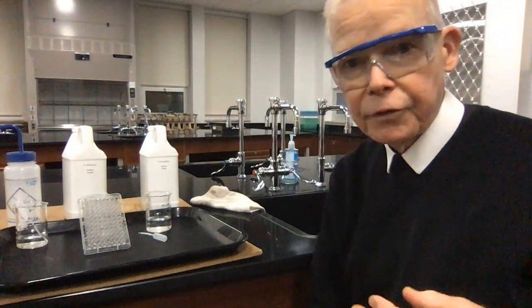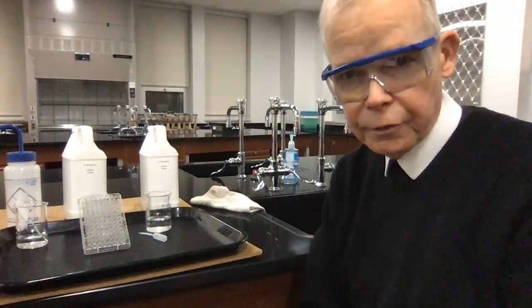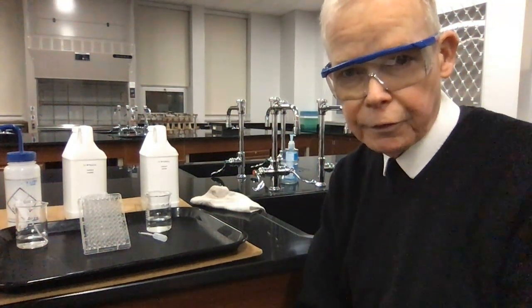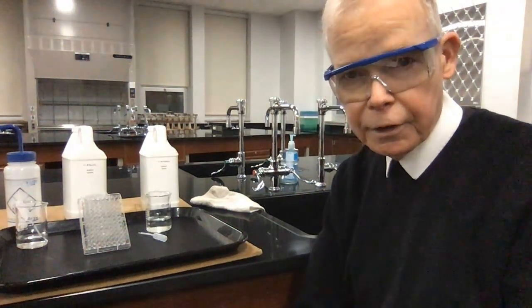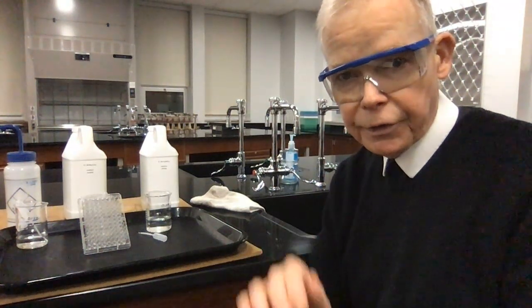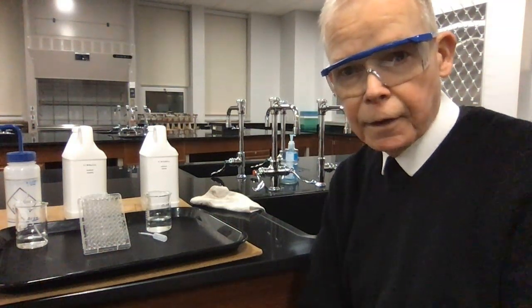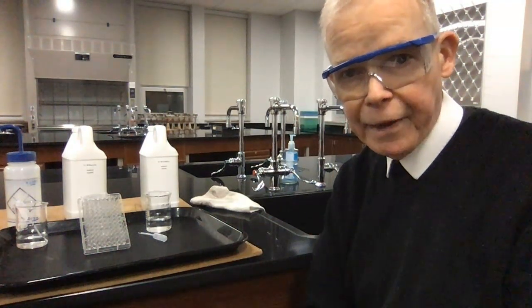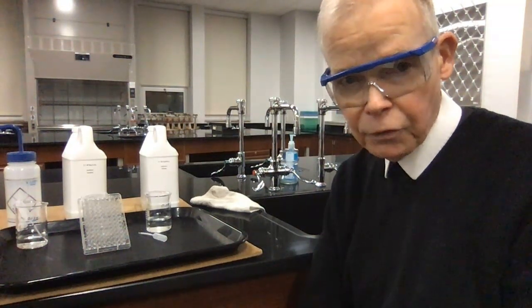You normally would have been in the lab here doing this. I tell you the most difficult part is getting the drops to be evenly equal volumes. Sometimes you can be off a little bit. Ours worked out pretty good. When my students do it from time to time, that's the area sometimes where there's little mistakes. But having done it for you, you now have the background. You get a sense of how to do it, how it was done.